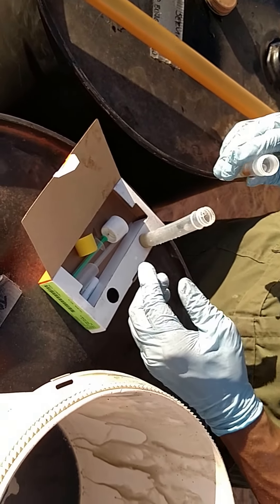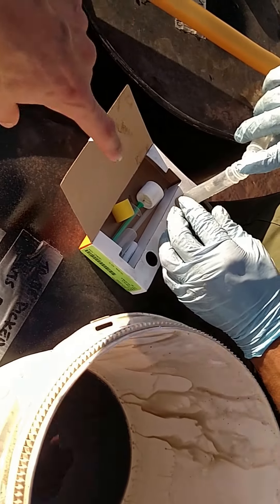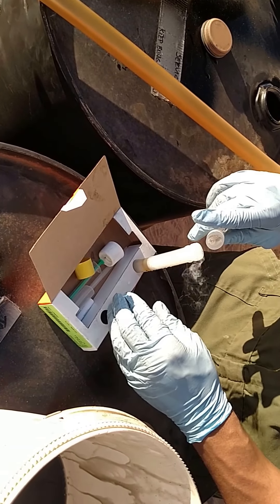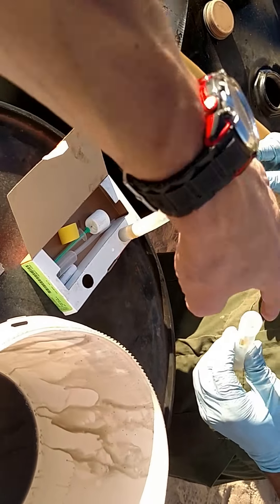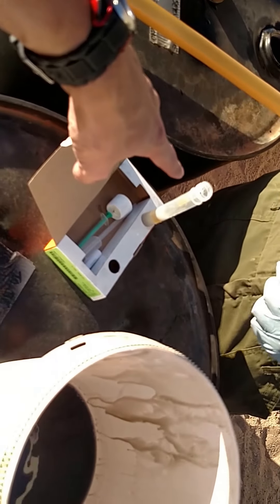You gotta hold it — put your finger in front of the tube so the vial doesn't come out. The ampoules — hopefully you didn't waste all of that sulfuric acid. Nah, look, it's still reacting. That yellow stuff is part of the ampoule on the inside of there. All right, now close off the white one.